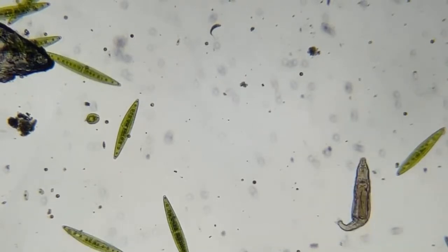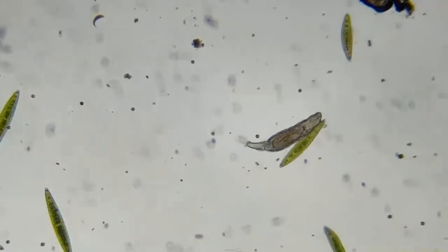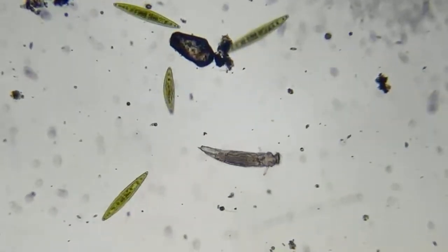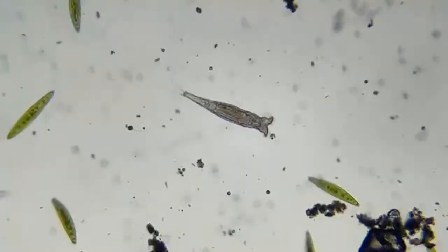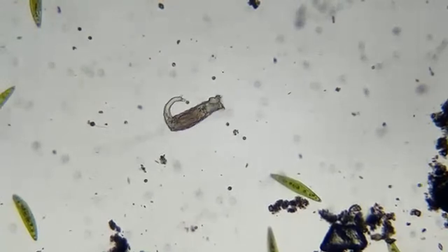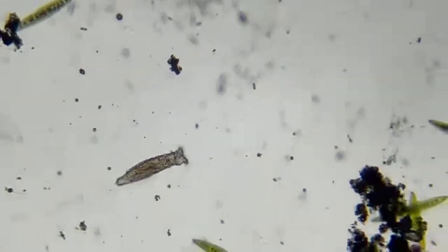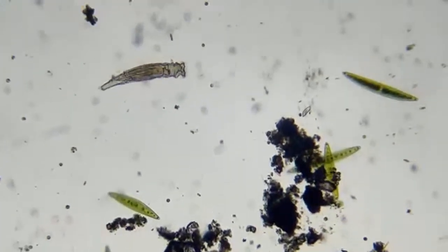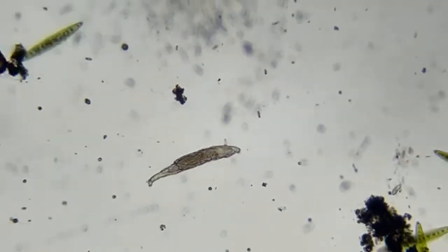Miss Art asks, the next upgrade to my microscope, would that show any significant difference in what you're seeing right here? Remember, I have polarizers and a phase contrast, which are in the hundreds of dollars, and each of them serves a purpose.